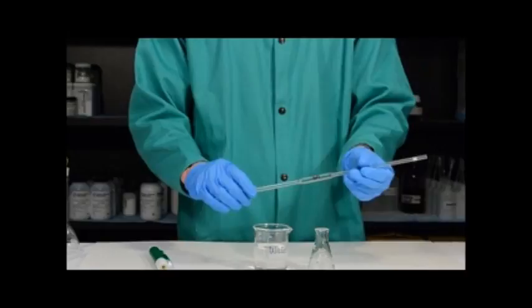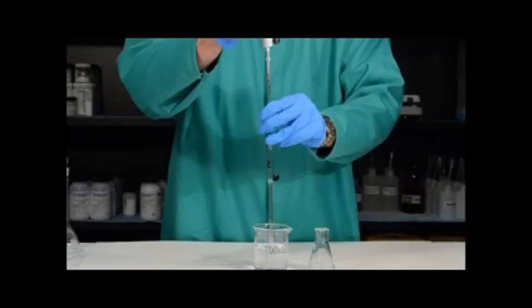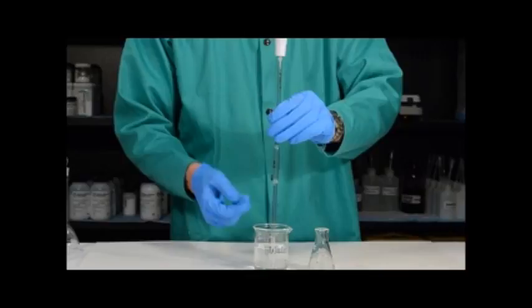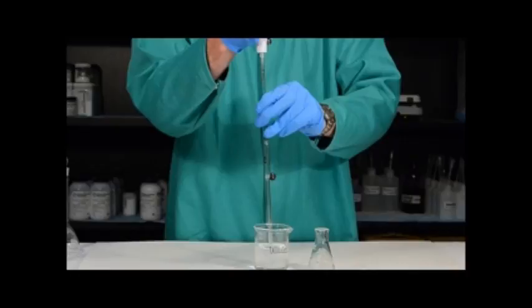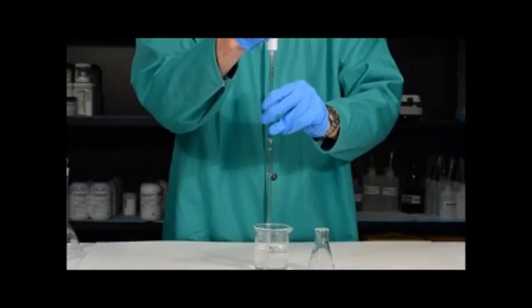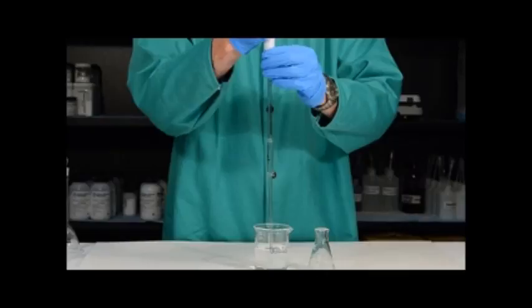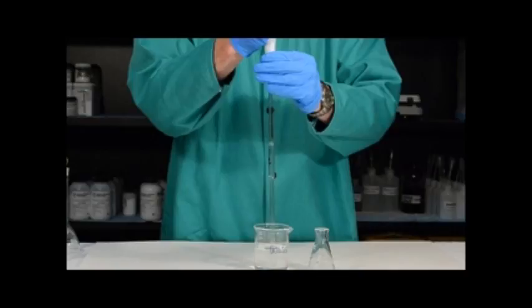Now that I have all the tools I need, I simply want to place the pipette into the beaker and place the pipette pump on top. Before I start to draw liquid into the pipette, it's very important that I lift the pipette slightly off the bottom of the beaker, because if it's exactly on the bottom you're blocking the hole where the water comes in. Once lifted slightly, I scroll the wheel and draw water into the pipette above the calibration line. I then quickly remove the pipette pump and place my thumb on the top of the pipette to keep the liquid from flowing out.